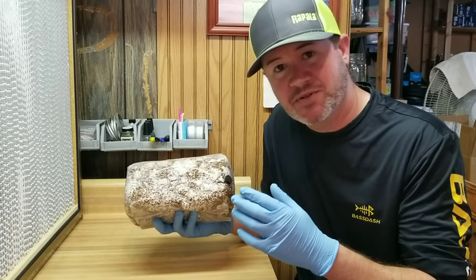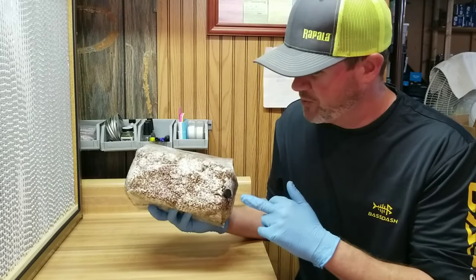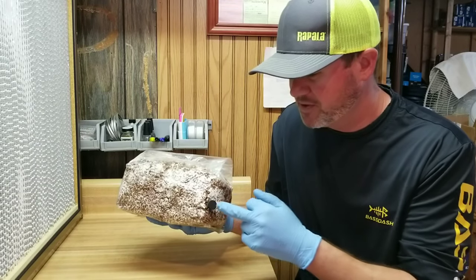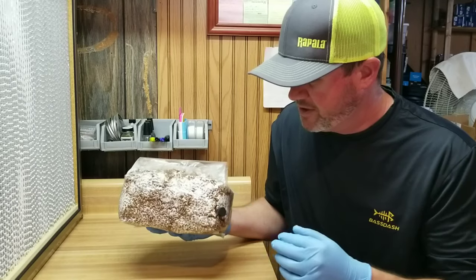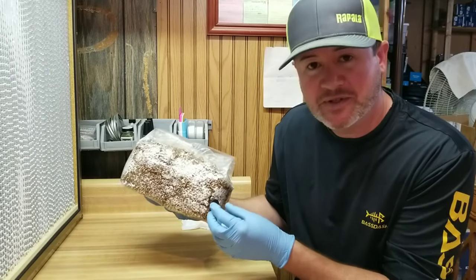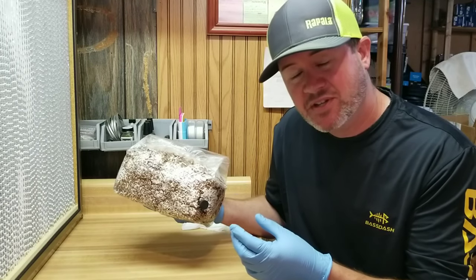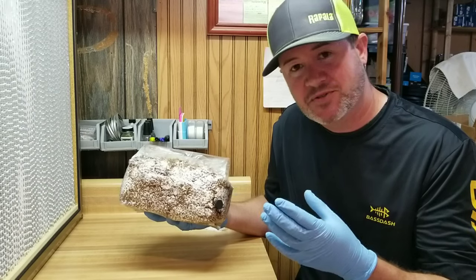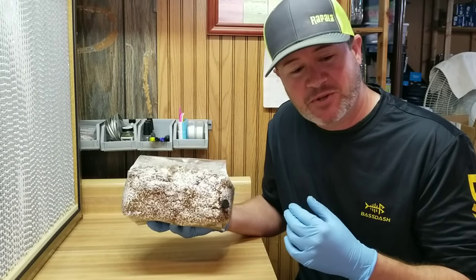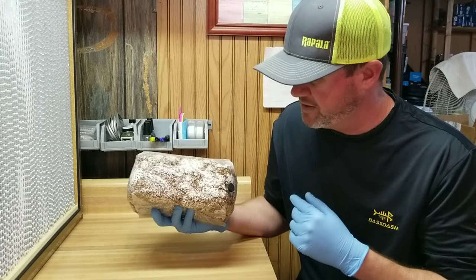What we're going to do is pull some pre-sterilized nutrient broth out of a jar and inject it right into this bag. I wiped down the surface of the bag with rubbing alcohol and stuck on one of our micro-pore self-healing injection ports right on the corner. We're going to take a syringe full of nutrient broth, shoot it up into the bag, let it filter through all the grain kernels and mycelium, and then suck the liquid culture back out. That liquid becomes the base for a new liquid culture jar — you inject it back in and let it grow out for a couple of weeks.